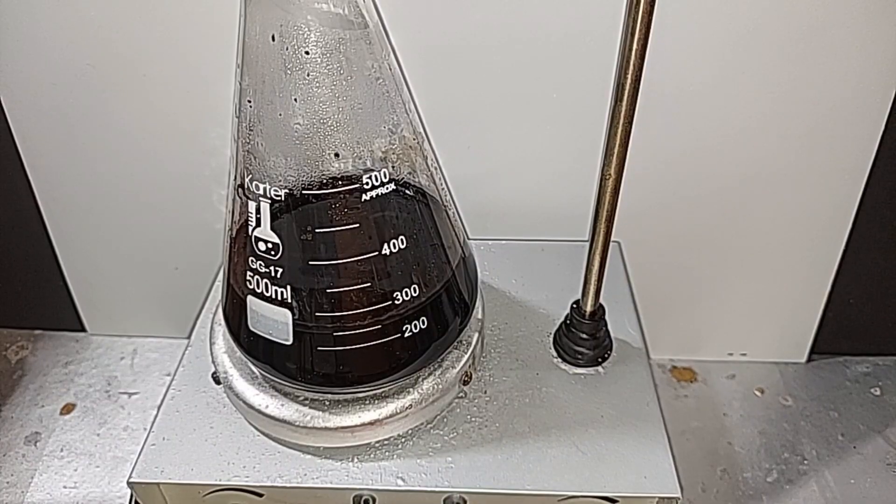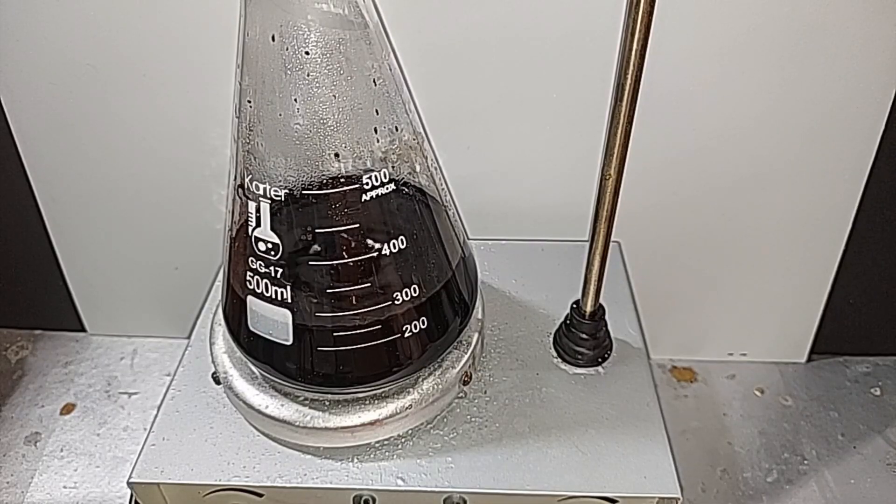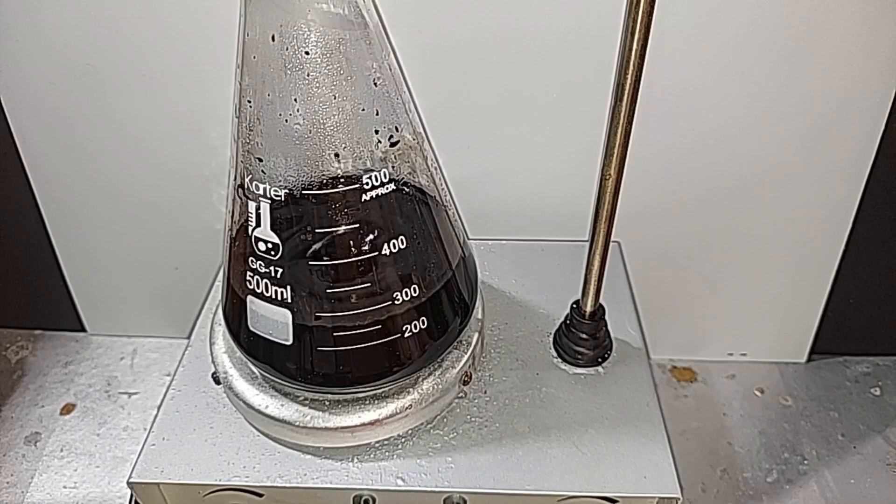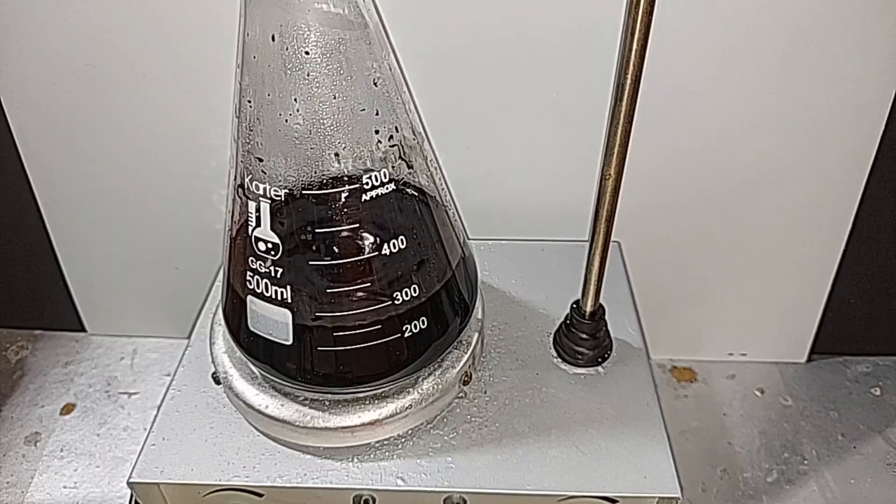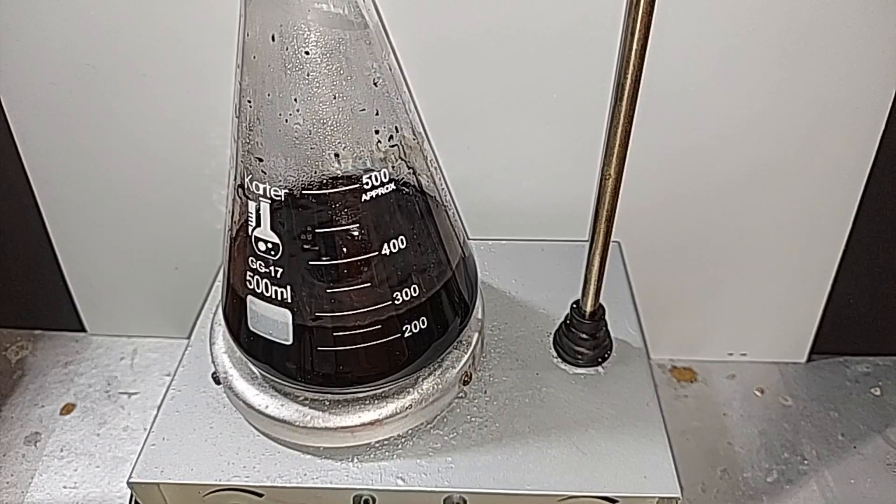I've got the solution here on my magnetic stirrer. I'm going to turn it on and leave it for an hour to an hour and a half, a long time, because I'm not 100% sure I got all the small pieces broken down. I know I've got the big ones, but not for sure about the smallest ones. This is just to make sure everything gets broken down into the smallest particles.